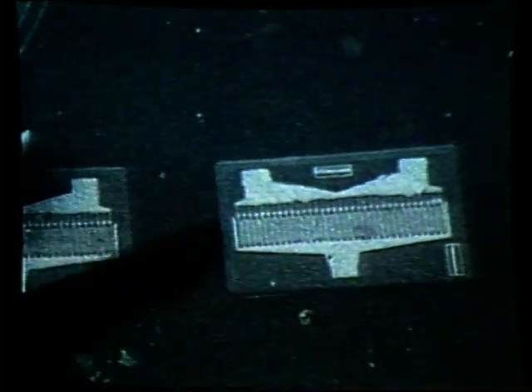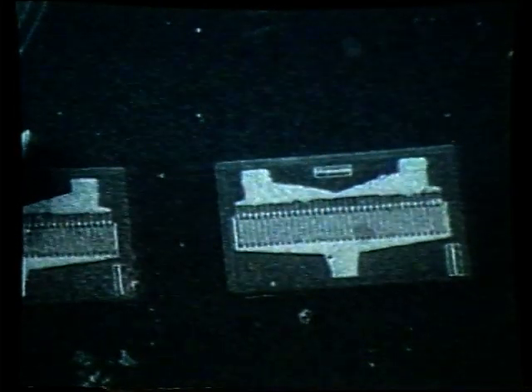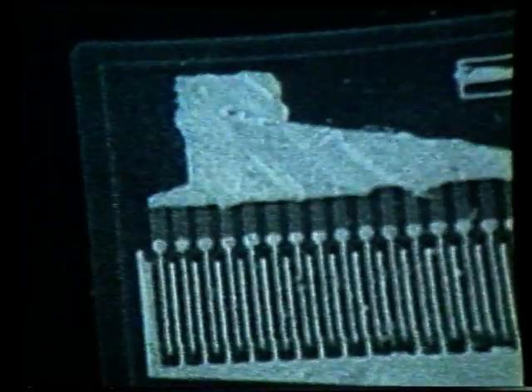We now have a sharp image at this magnification. Let's increase the magnification. By slewing the magnification, we now have a magnification of a little over 1000x. We can now also press soft key number 2, reactivate the auto video. It will then again very quickly give us a good contrast, resetting the SED multiplier, gain, brightness, and contrast.